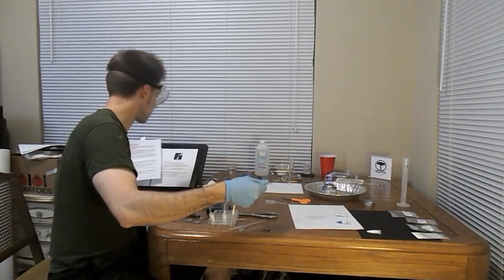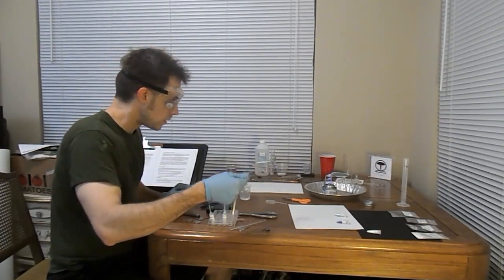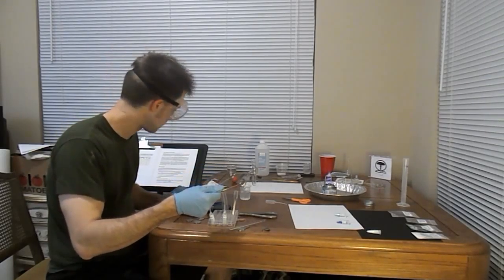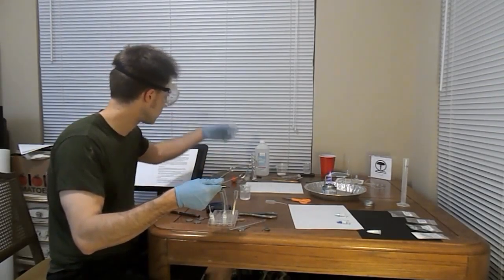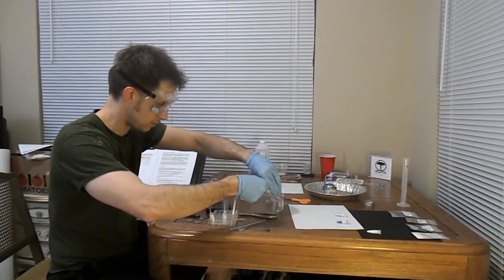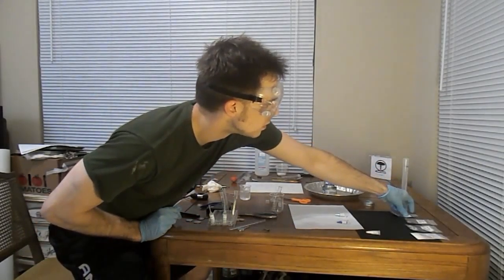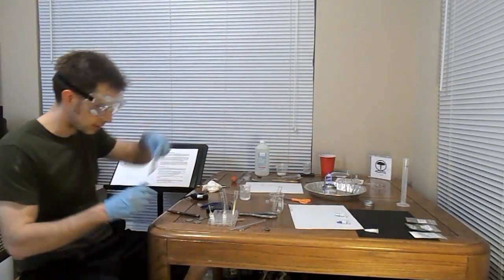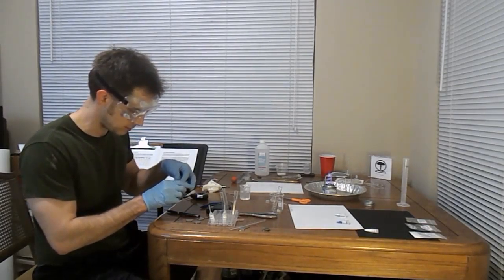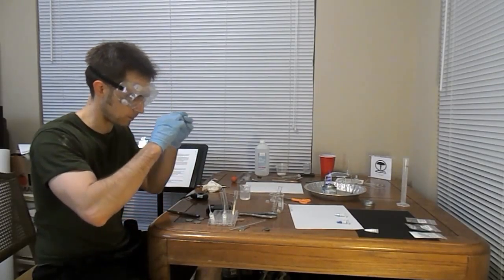Right. And we'll let that cool for a minute. It's like a great place to let it cool. Empty container. It's beautiful. And the second thing we're going to do is test this same substance, magnesium, for cold water solubility.